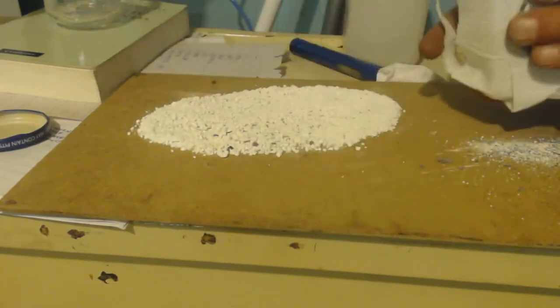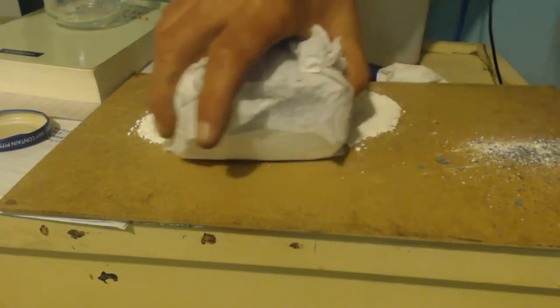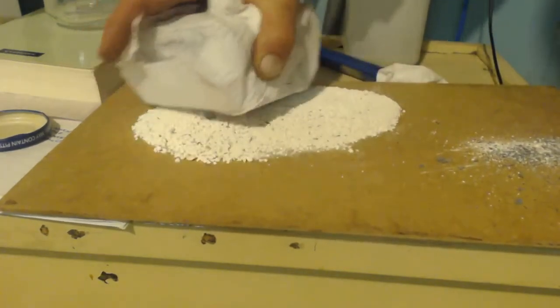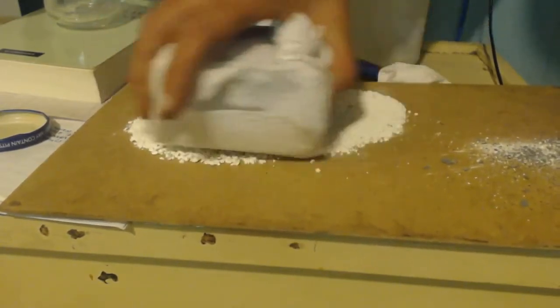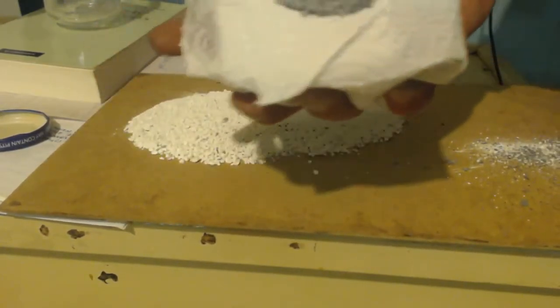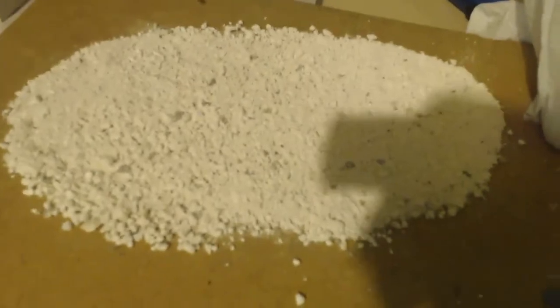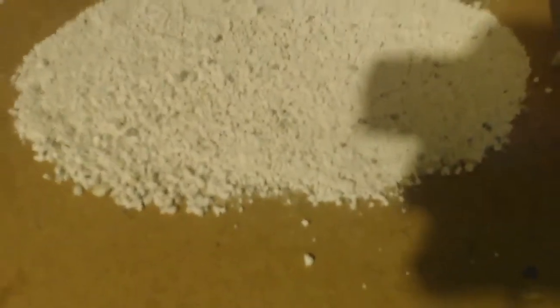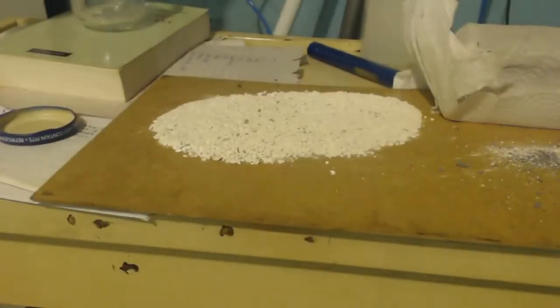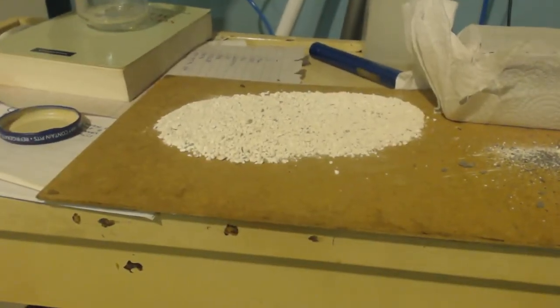I got some more. You can see it's getting whiter and whiter. You get the gist. Look at that, it's nice and whiter now. You can barely see anything in there. I mean, there's still stuff in there. I'm going to clean it up better. Check it out. Thank God, now I don't have to make some more, do all that again.